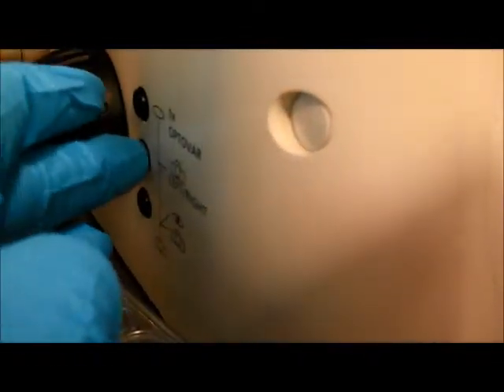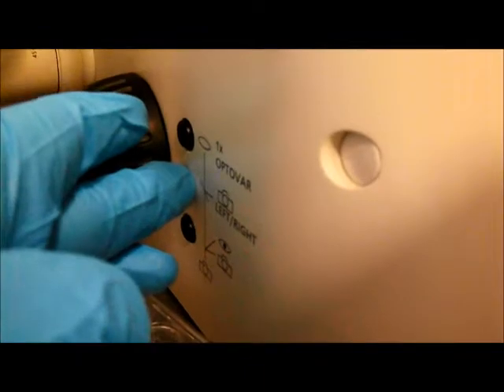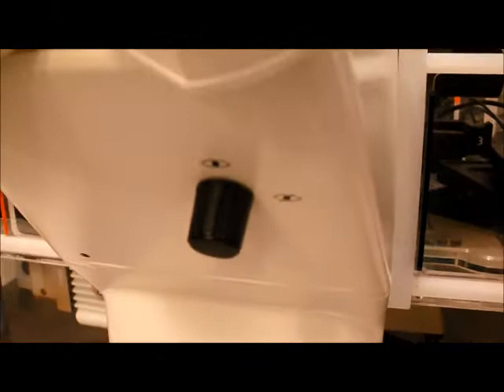Then I change this middle one here until I get to 100% left. So that's on the right. It's a little bit strange. That might be our image, say. It might be a little bit dark. What you should do is turn off the eyepiece there. Go back to here.